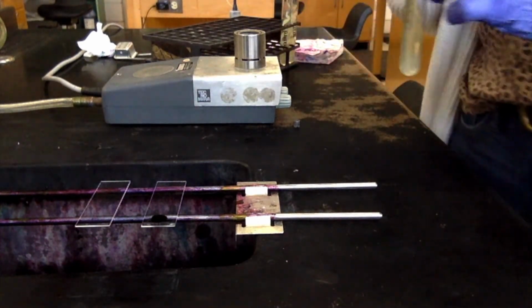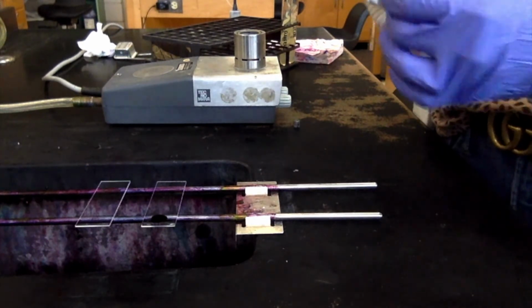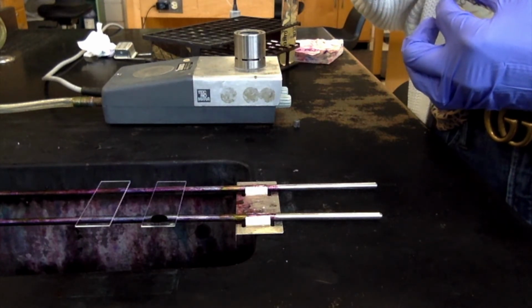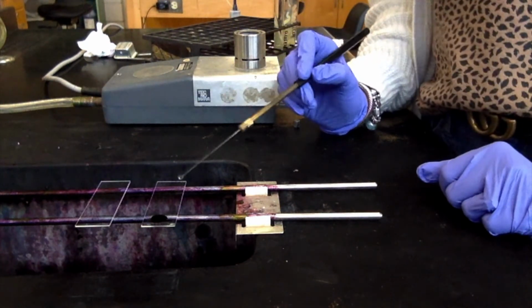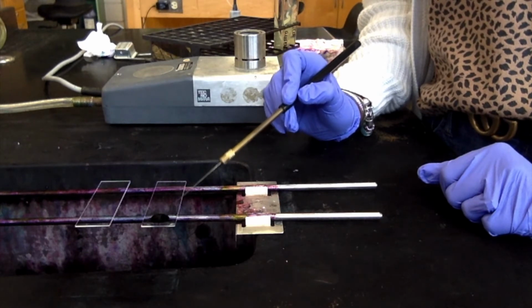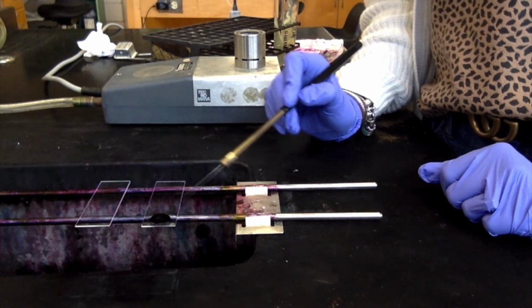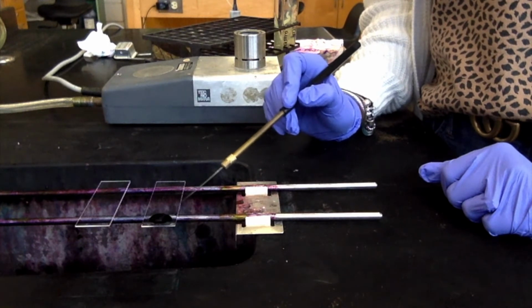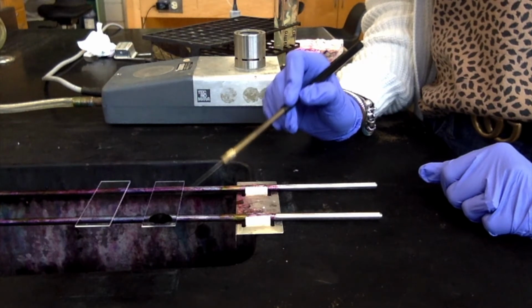Now we're ready for our bacteria. We're going to use Bacillus for this just because it forms these nice long chains, and it's a really large rod, so it makes it really nice under the microscope. We're just going to get a little bit of the bacteria out of our tube. Of course, I've already flamed my loop. I'm going to tap the loop into the little puddle of ink that I have on one side of the glass slide. You're not going to see anything when you're doing this. You just have to trust yourself that you're getting some bacteria into that black ink. And you're not smearing it, you're just tapping it into the liquid.